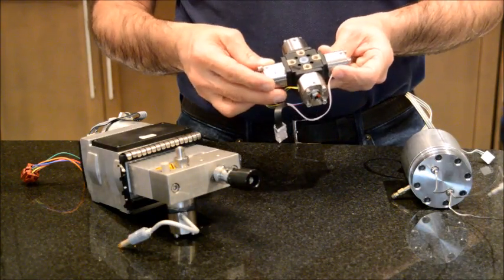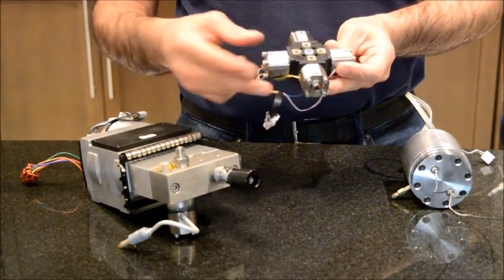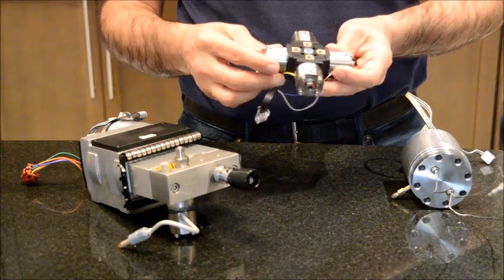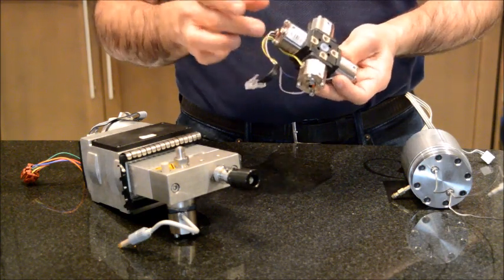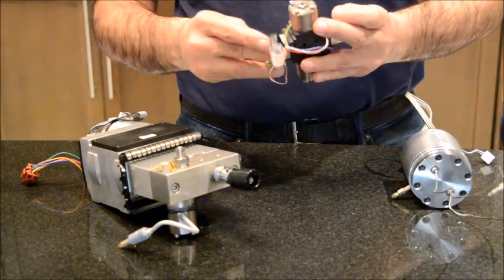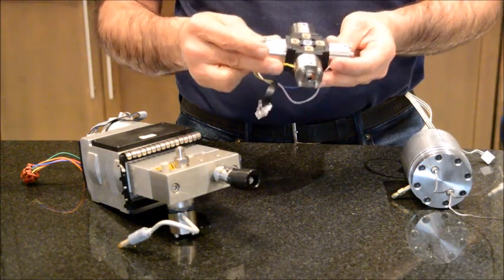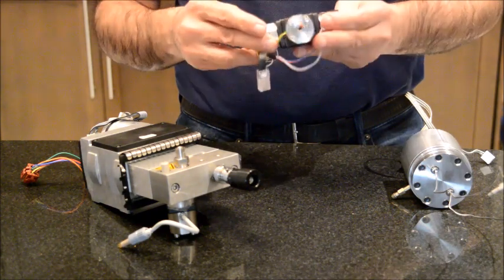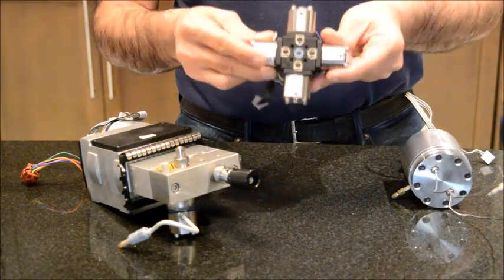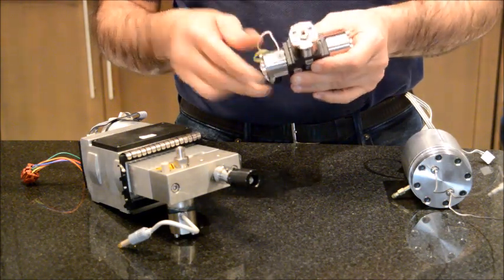Option number three is that you may want to attempt to fix it by opening it up, and I don't encourage everybody to do that. Probably you're going to do some damage. A person who has done it before and succeeded in doing it should probably attempt doing that. But for the purpose of this video, I don't mind opening this up and we're going to take a look at what's inside of one of the valves.